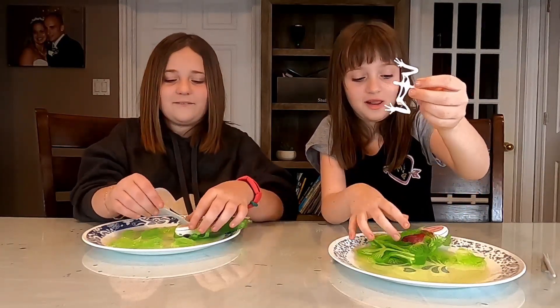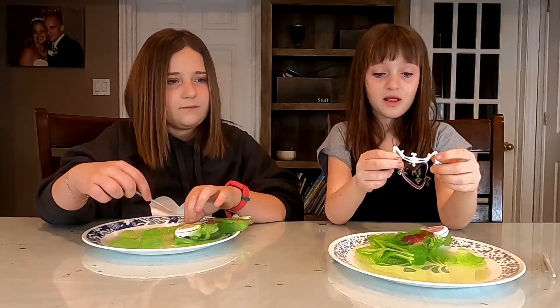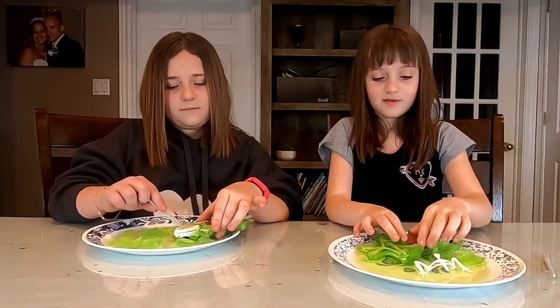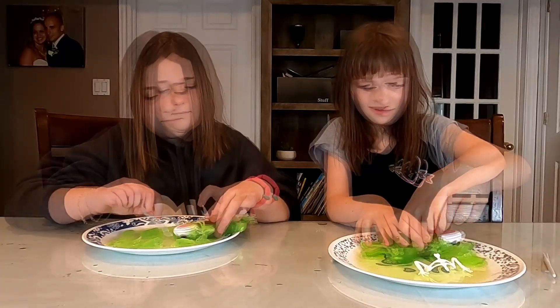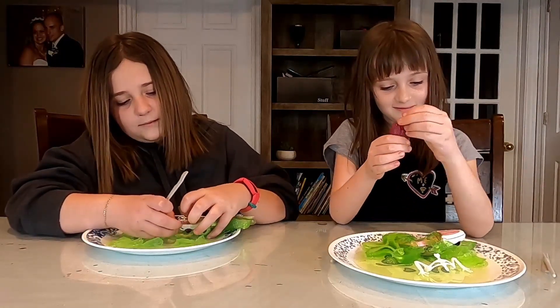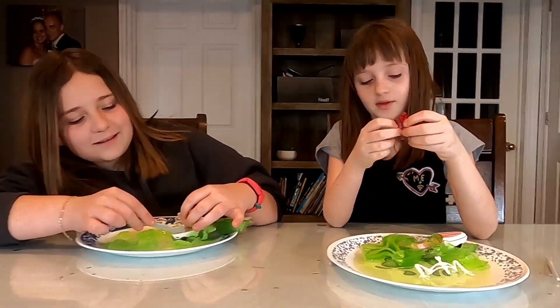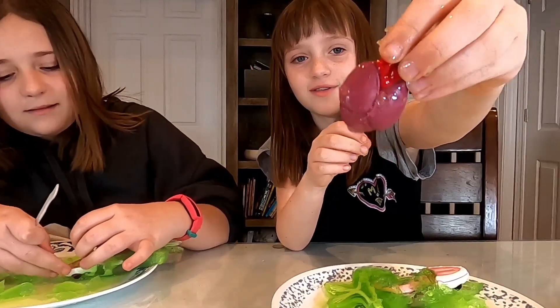So Miley, you got a piece removed. What do you have right now? I have his hands and a part of his thing. His eyes — his mouth is open. Hold it up close. I think this is the heart. That is his lungs.